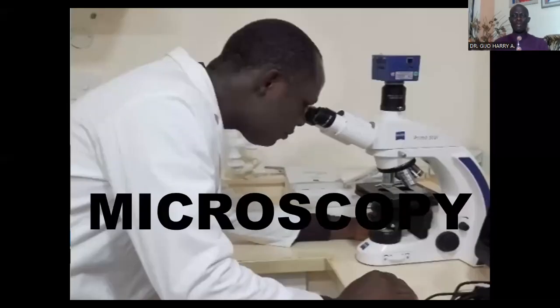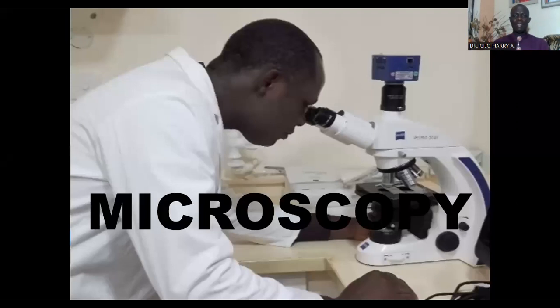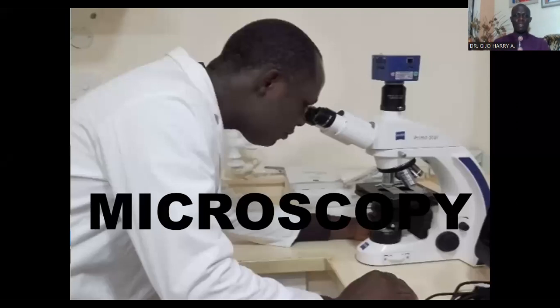Hello, you're welcome to our lecture series on biological techniques. Today's lecture will be on microscopy. In the course of our discussion, we'll look at the introductory part and we'll also look at very important aspects of microscopy, such as magnification and resolution.